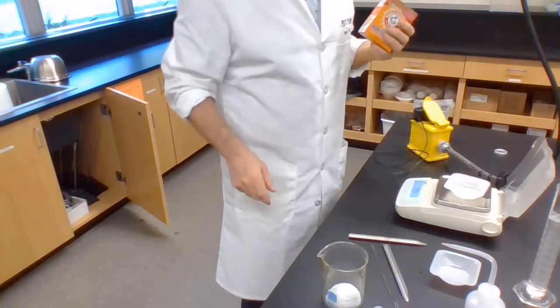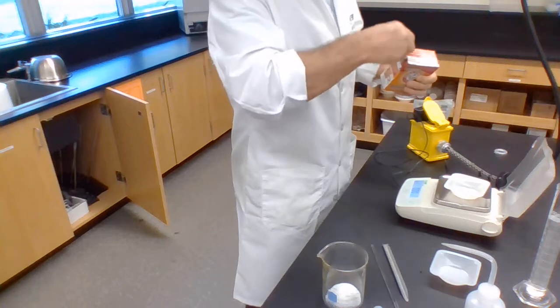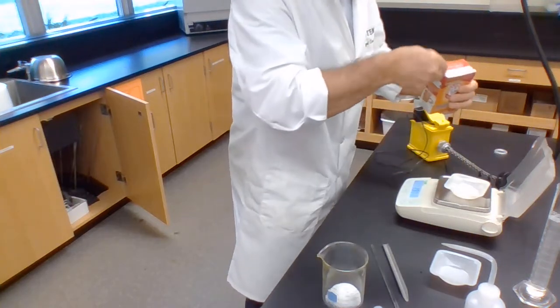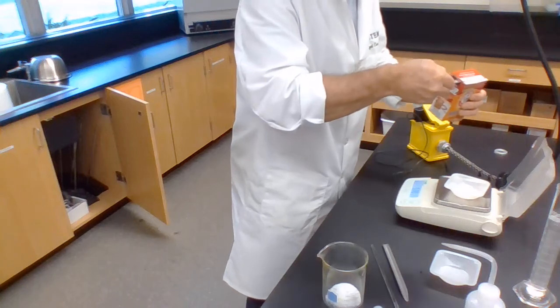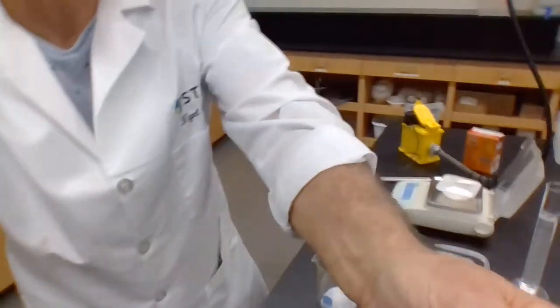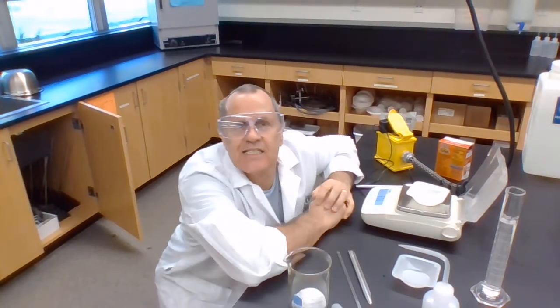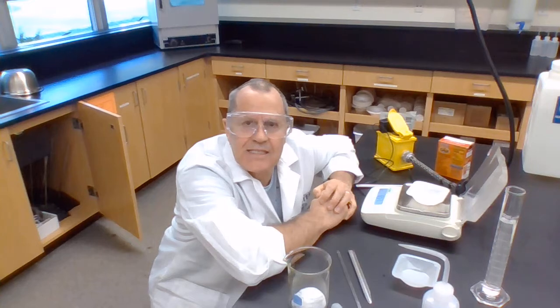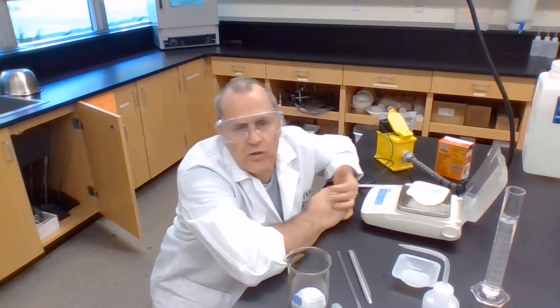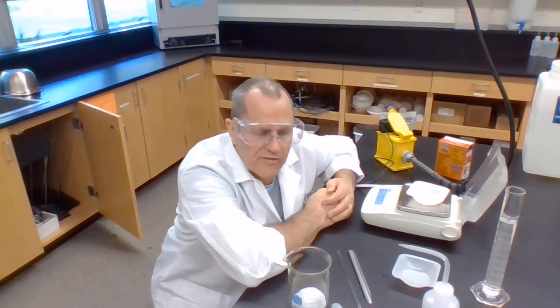And here's my other thingy here, and I zero it, and I take some out, and some out, and some out, and some more out, and I get exactly this much. Oh, I don't know if you can see that. Yes, you can see that. Right. And you should be able to work out how many moles that is, because you've got some masses. You can look up the formulae, or use what I put on the board a minute ago, and therefore work out the formula mass, and hence you can work out the number of moles of this.